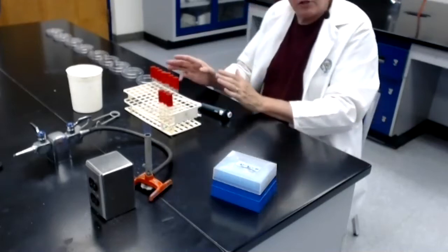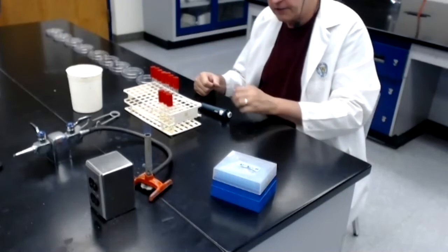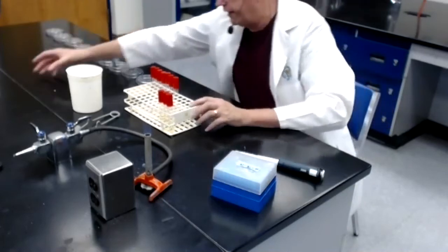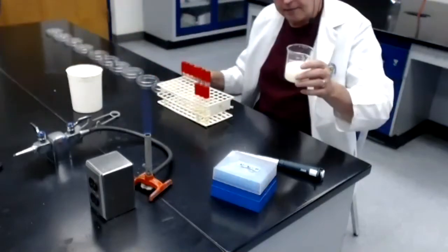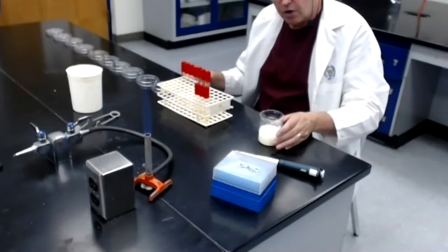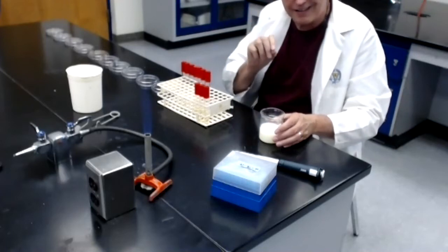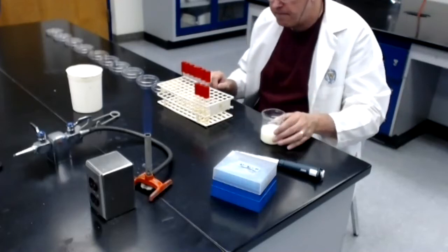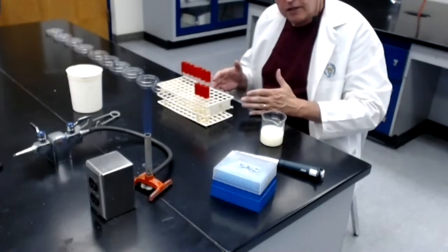Now I'm going to go ahead and do the other dilutions off camera, and then we'll come back and I'll show you how to handle the plates. But before I go off camera, let me just recap what we've done here to make sure you understand exactly how this is working. We started with a contaminated milk sample. We're attempting to determine the number of bacteria per mil, or actually, as your lab manual points out, the number of colony-forming units per mil of milk. We are doing this by performing what's called a serial dilution.